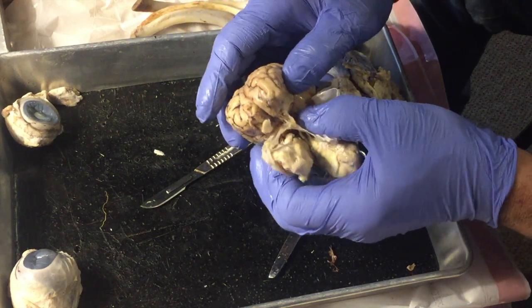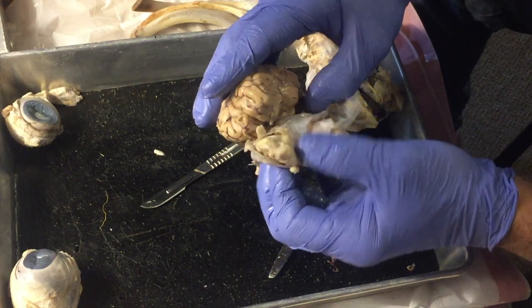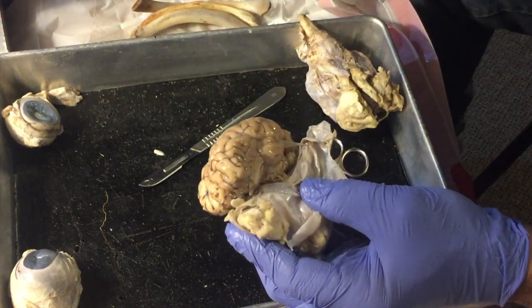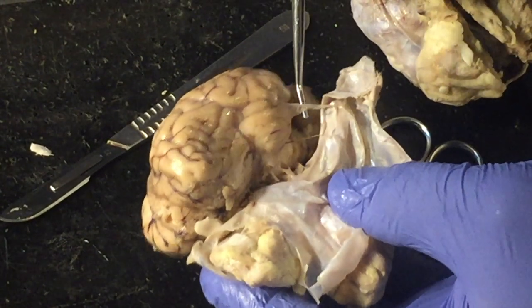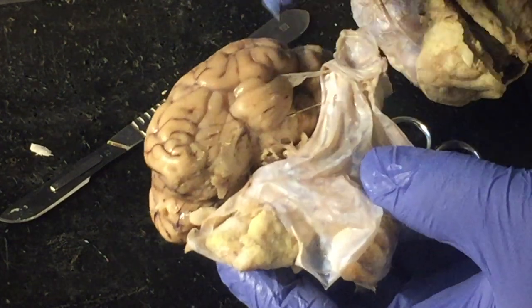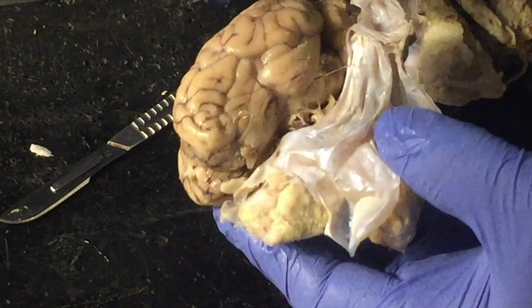We talked about the brain, the 43 nerves, the cranial and spinal nerves. So some of the cranial nerves you can see right here. Right here's a blood vessel that would go into the brain. So right here, this is another very fine layer on the brain here. I'm going to take that and see if I can just, I pulled it off now.